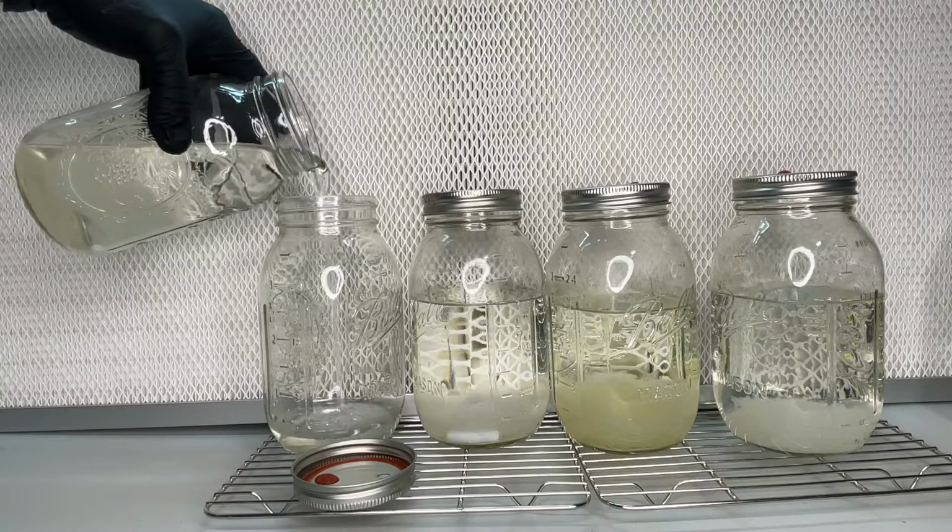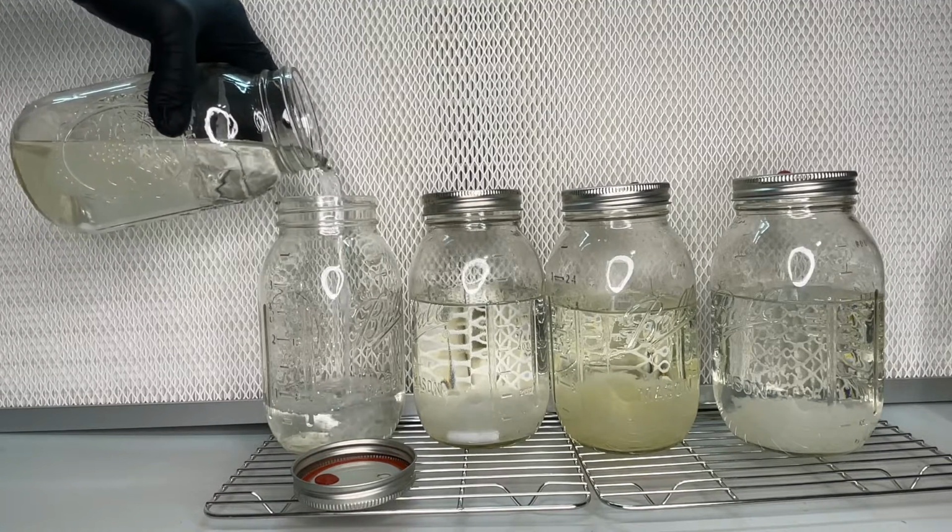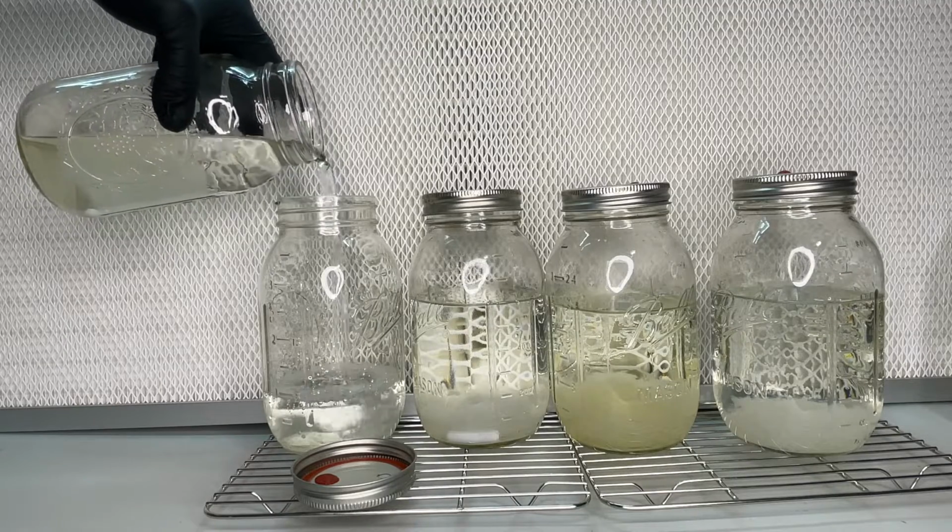So what I've been doing to solve this problem of not having enough mycelium in the jar is to take an empty jar and pour out the excess liquid.